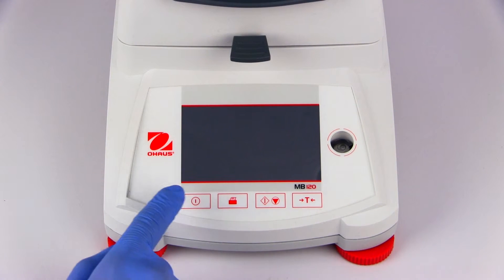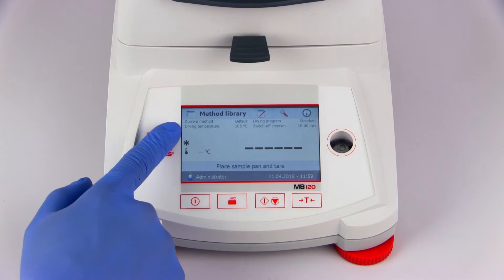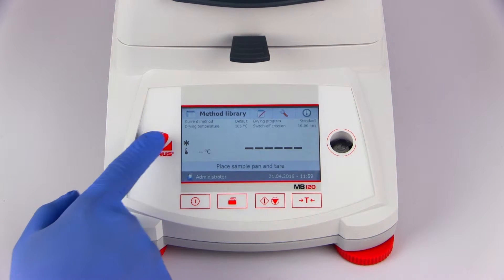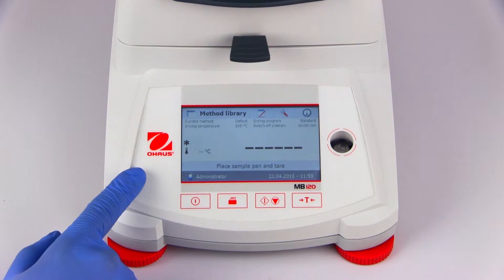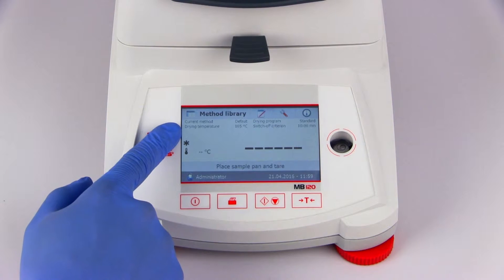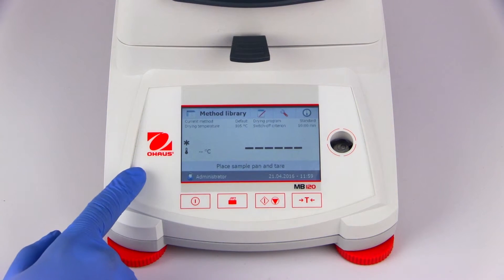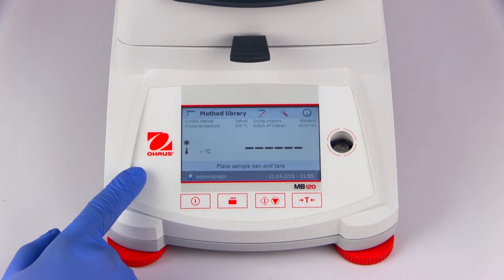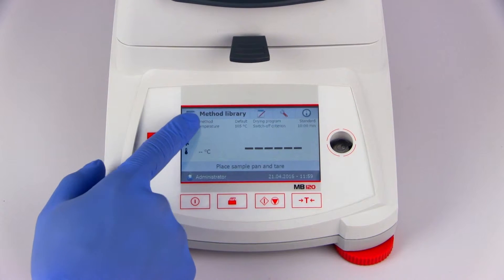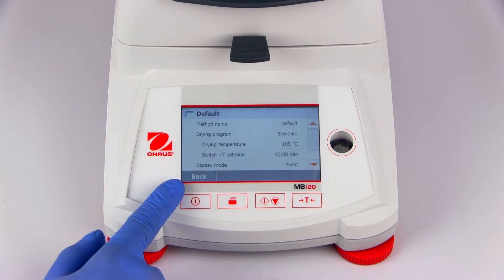When starting the device, the selected method is shown on the home screen as the current method. When starting a measurement, the parameters indicated in the current method will be used. The parameters of the current method can be manipulated directly by pressing on the displayed information.